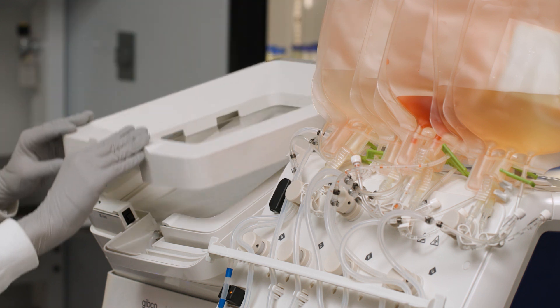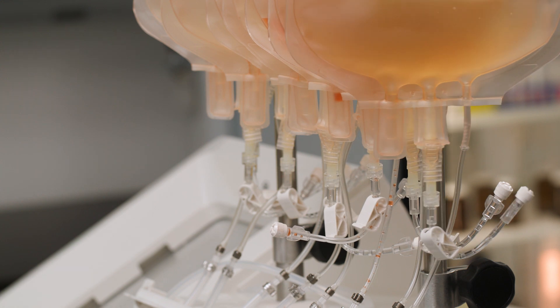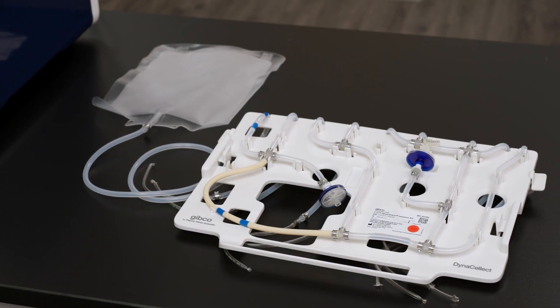It consists of a 1-liter isolation chamber, 8 weldable PVC tubes for input and output bags, and a cassette for easy installation.